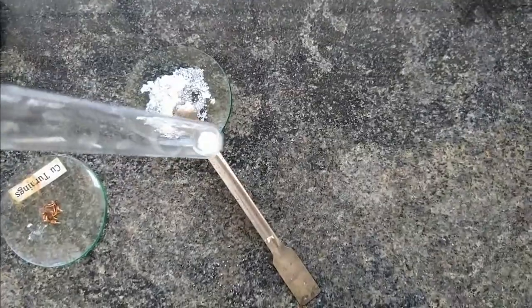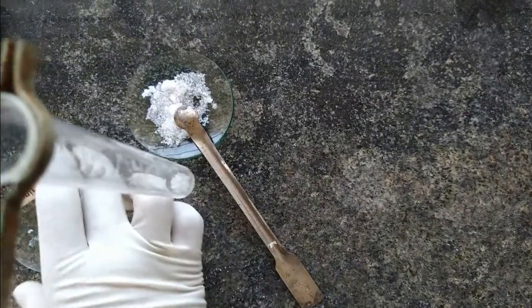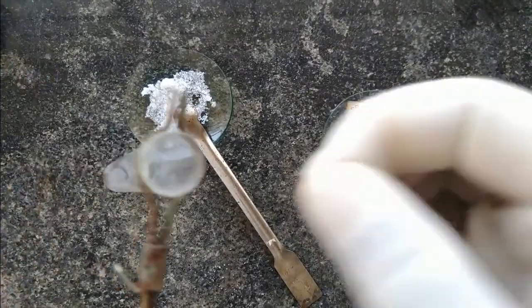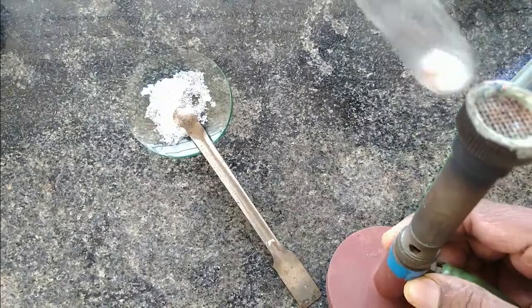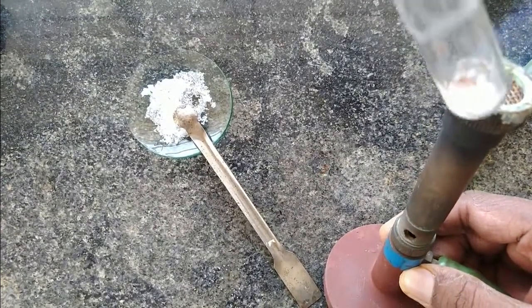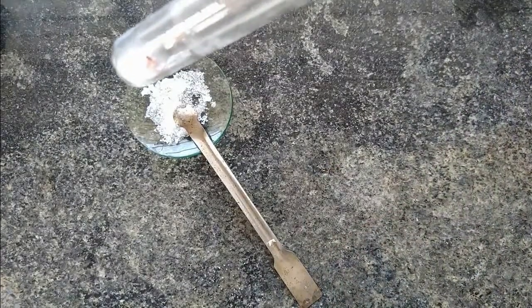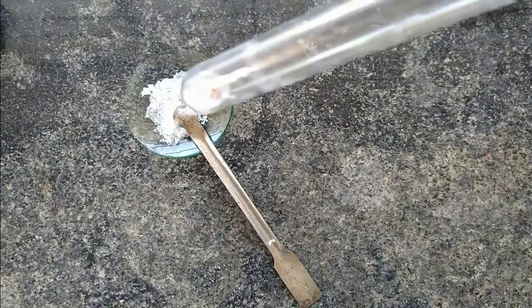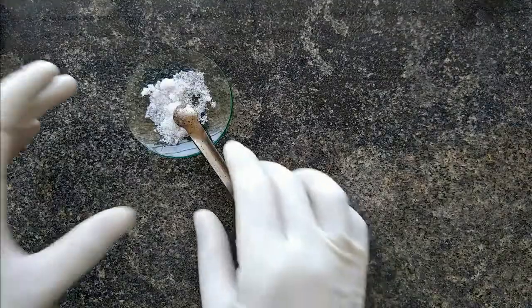Salt plus concentrated sulphuric acid — there is no action. If no action, we add copper turnings — hardly one or two pieces — to the same test tube, and heat it. After heating, again we are getting no action; we are not getting any reddish brown gas. This gives the inference that group two is absent in today's salt.